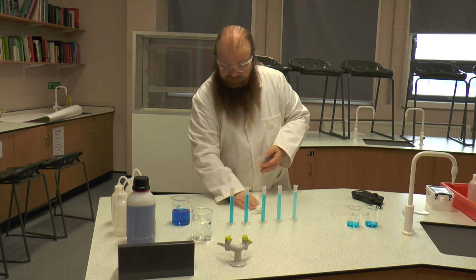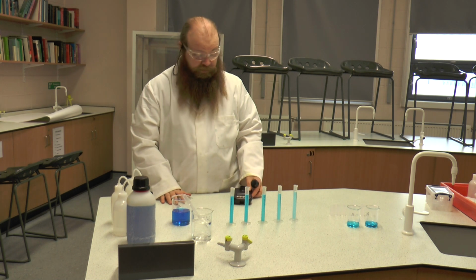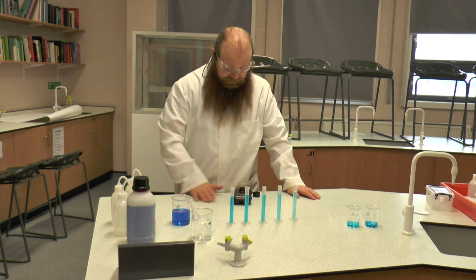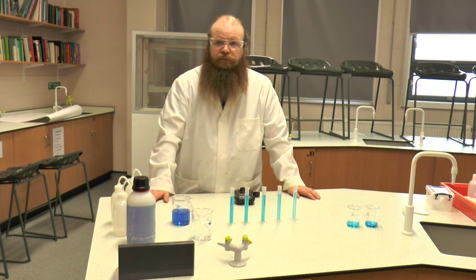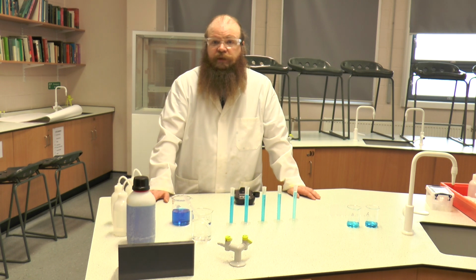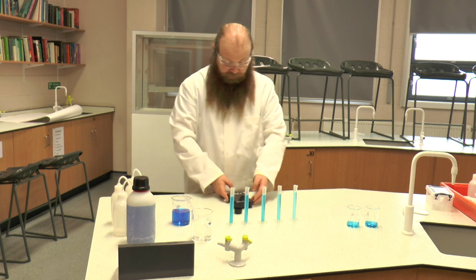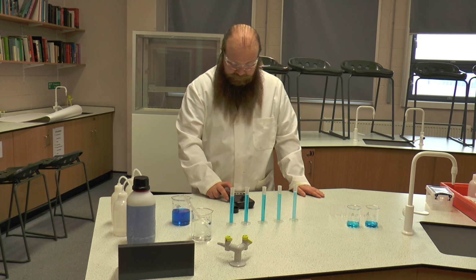Now, for the colorimeter itself to be effective, we have to look at what colour we're going to be setting it on. So the colorimeter in this case has 3 filters: red, green and blue. Now you would normally pick the filter that opposes the colour that you are doing on the colour wheel. Now the opposing colour for blue is somewhere between red and green, so it doesn't particularly matter which one we use, as long as it's not blue. Because obviously if we're using a blue filter with a blue solution, we will not get very good or accurate readings. Now in this case we're going to set it to be on transmittance.